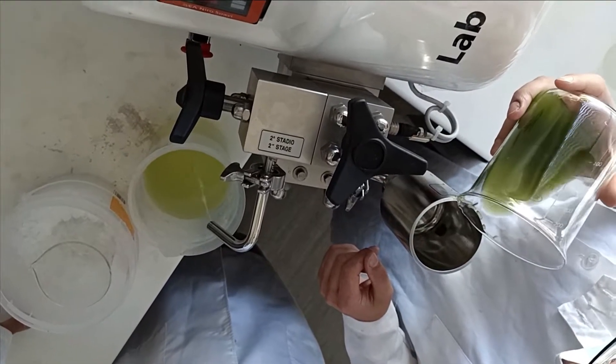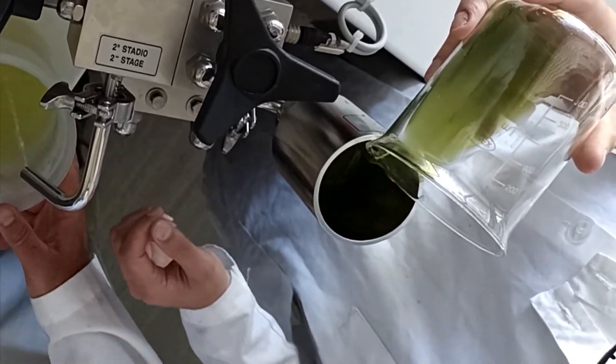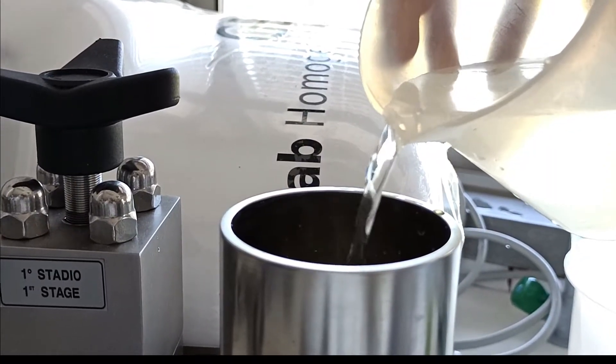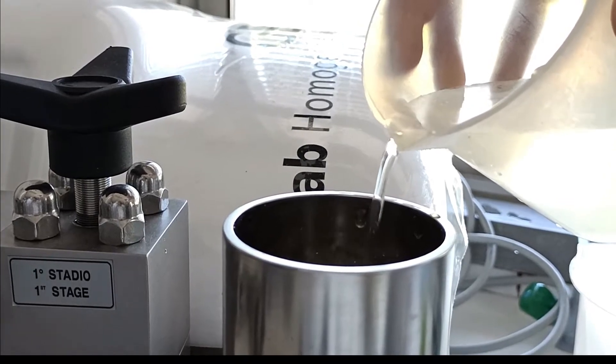Add the culture the moment tap water runs out in the inlet. Adding it before will result in dilution of the sample, which you might not want.